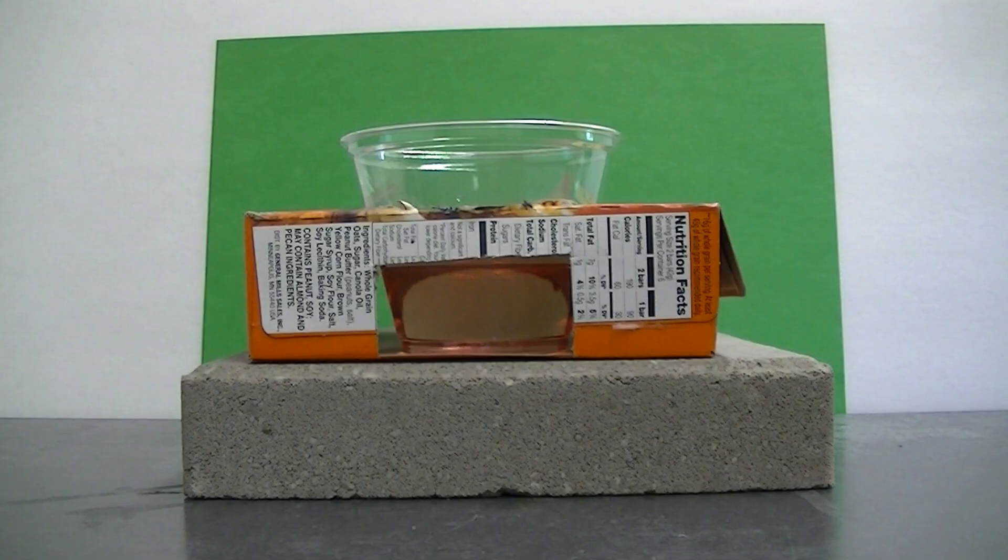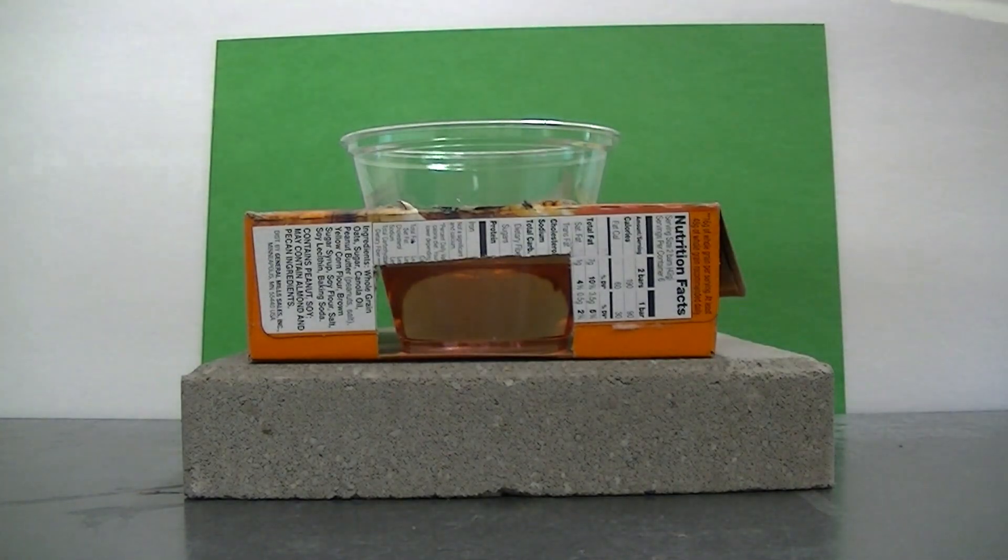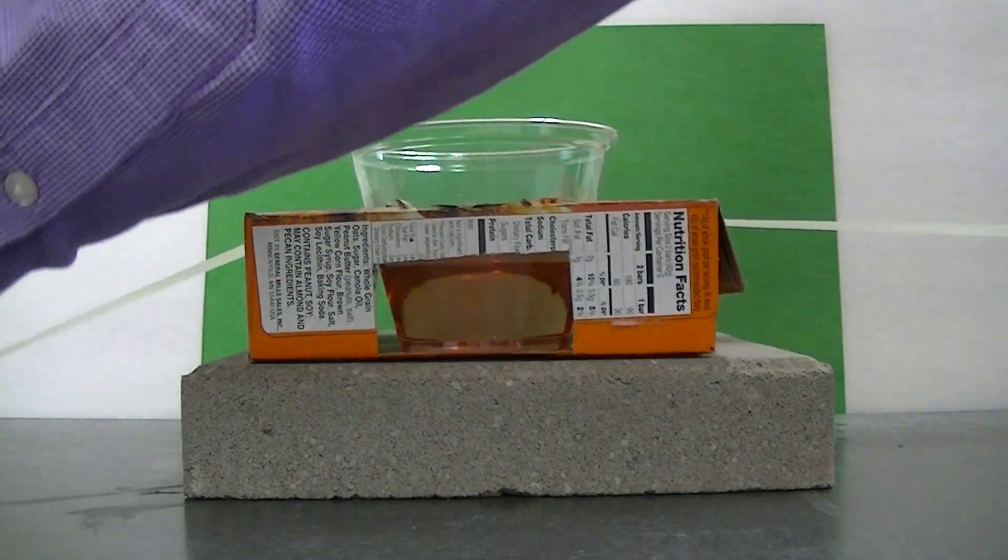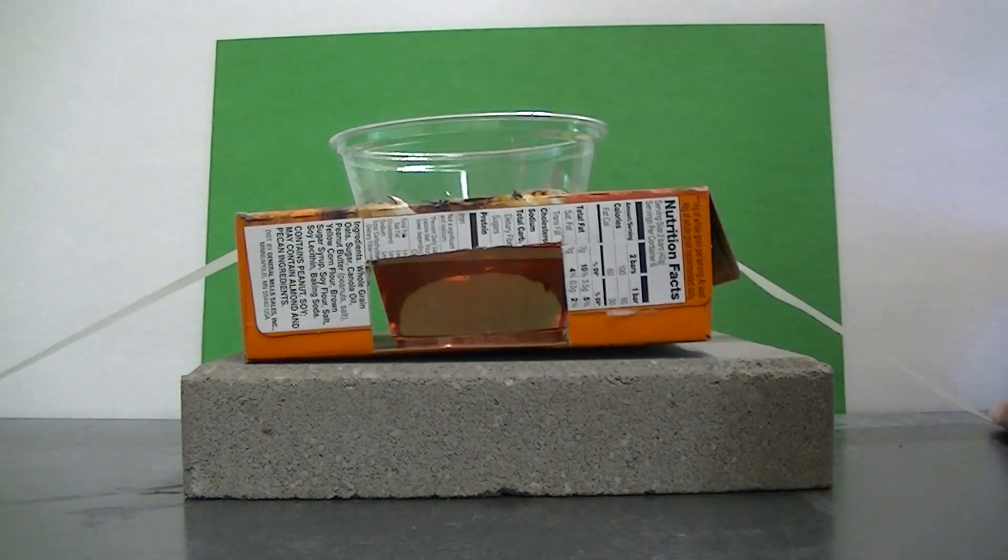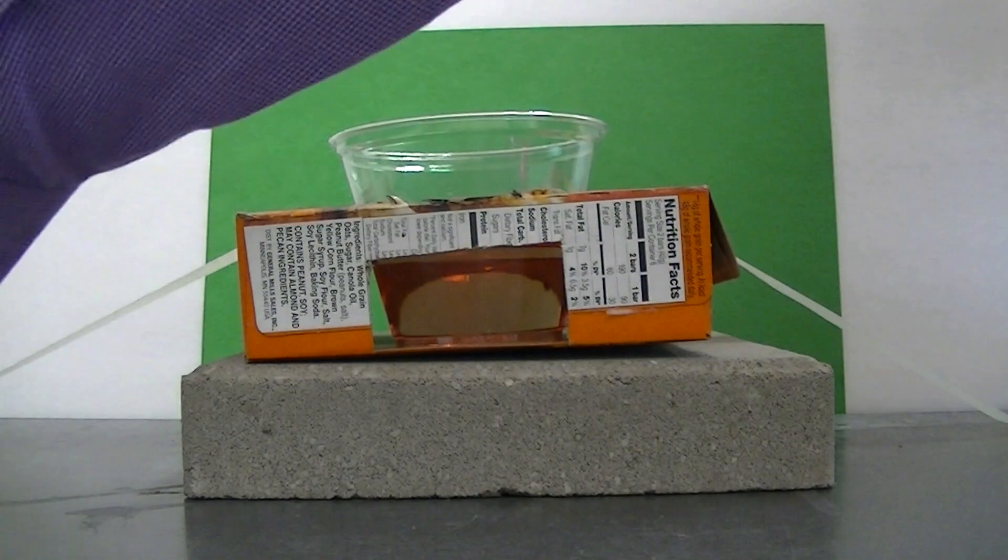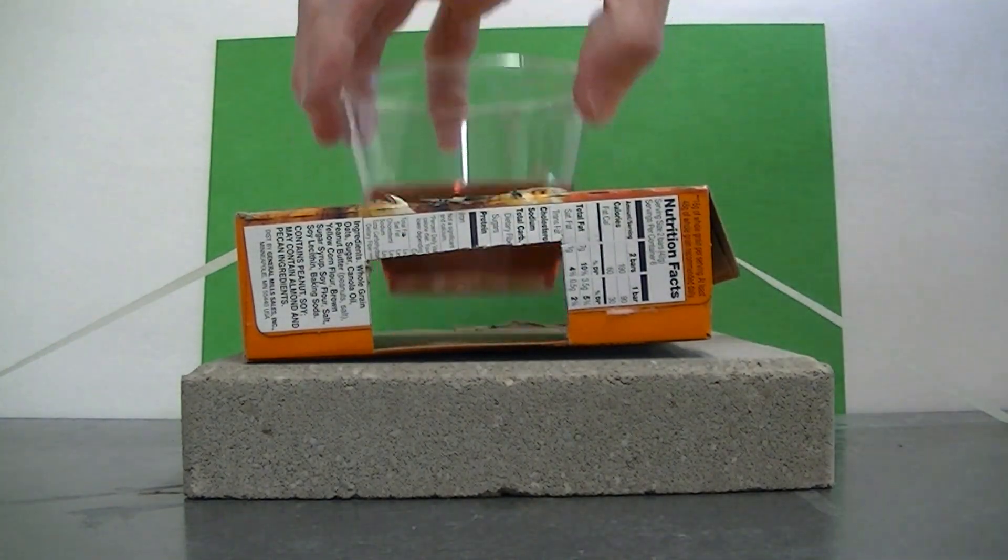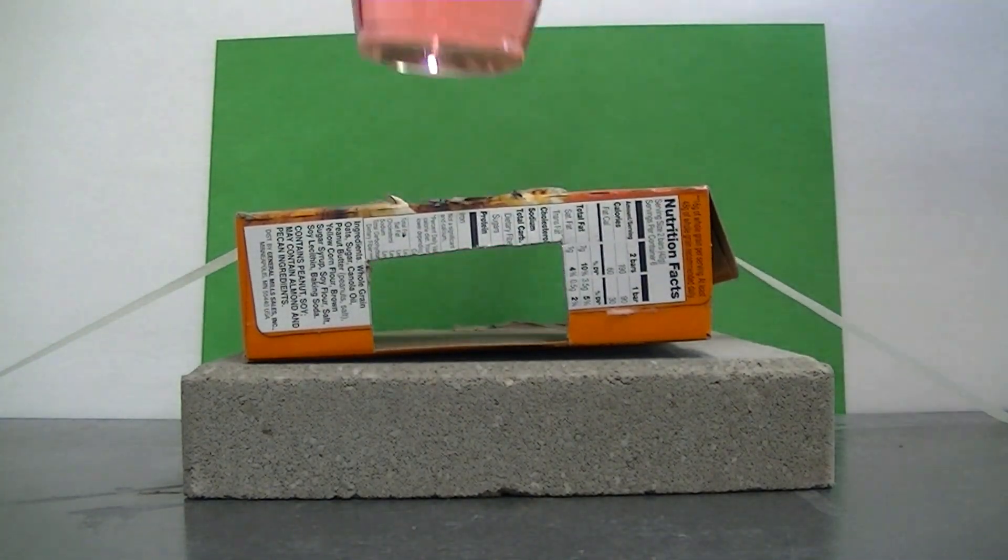When taking these measurements it's important to keep everything in a consistent position. And to help do that I'm just going to tape down the box so that I can put samples in and out and things don't get bumped around a whole lot. That looks pretty good.